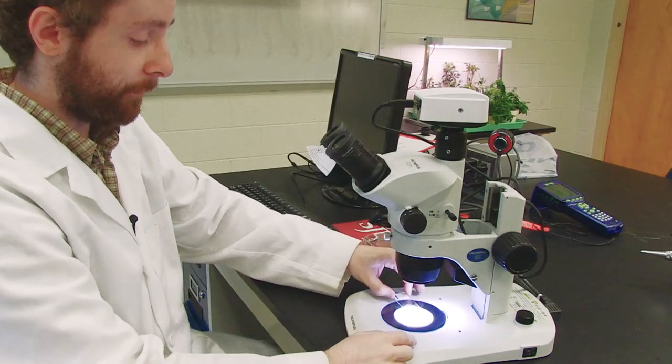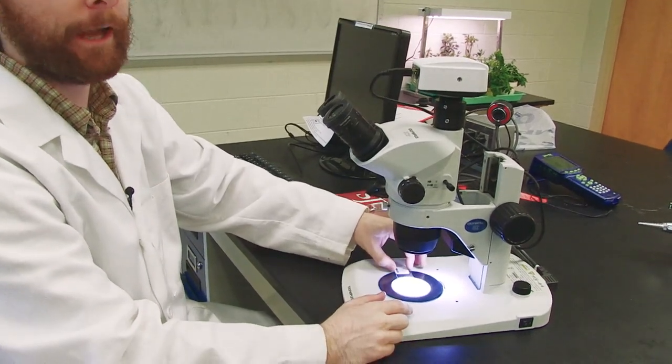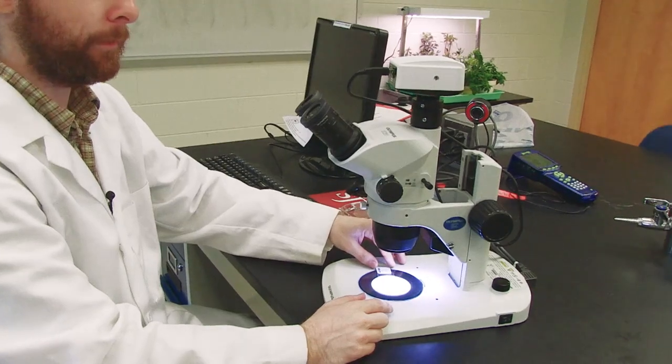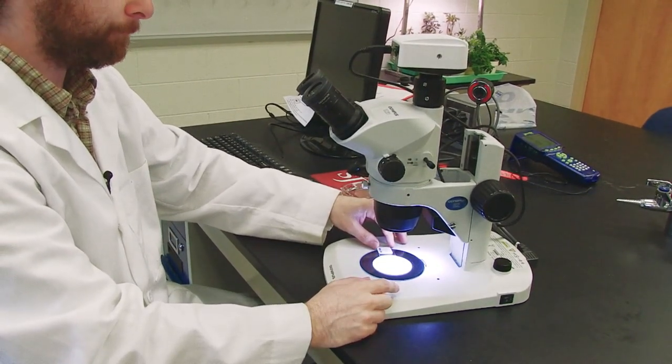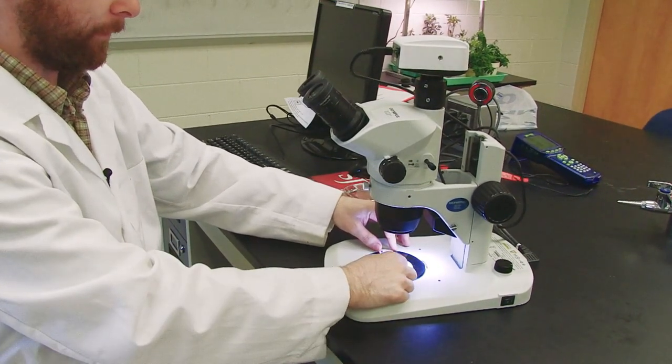I next take whatever I want to visualize. In this case, we'll begin with a slide. This is a slide of an animal known as the hydra. It's in the cnidarian phylum. And I place it on the stage.